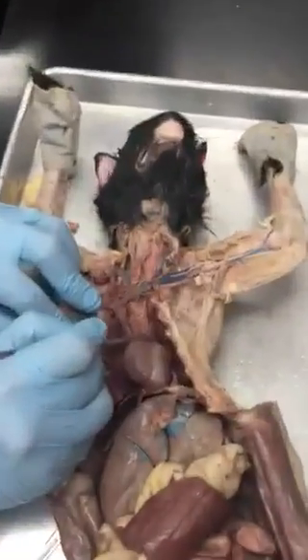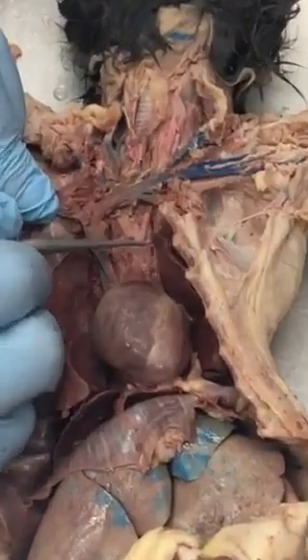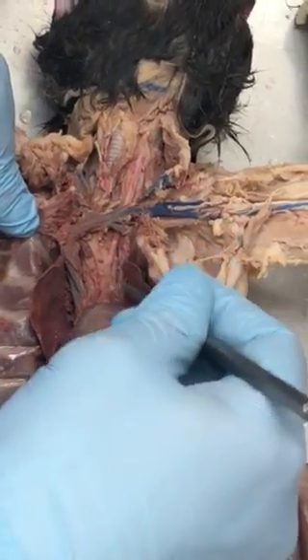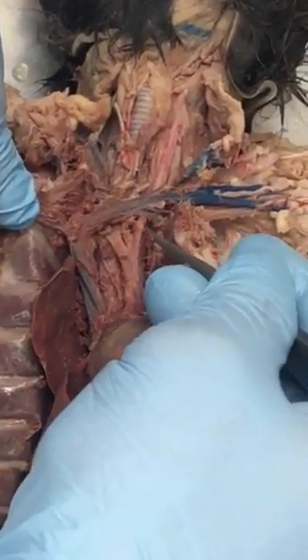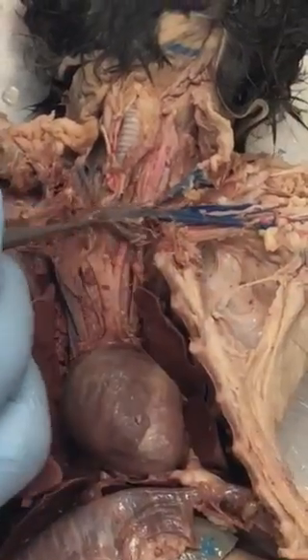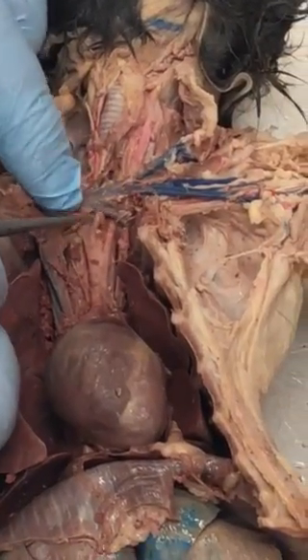Hard to see, but there is a blood vessel right there and that's the aorta. Here is the left subclavian artery. This is the brachiocephalic artery. This is going to branch into the left common carotid, and then underneath here there's the right common carotid.